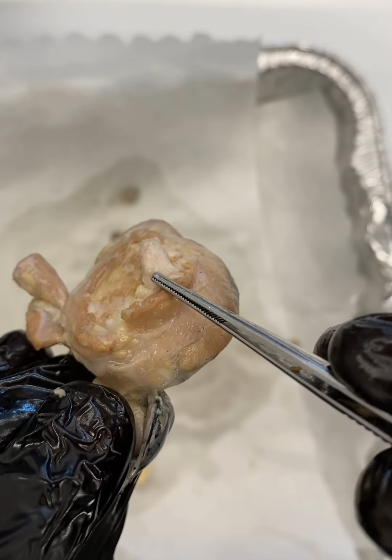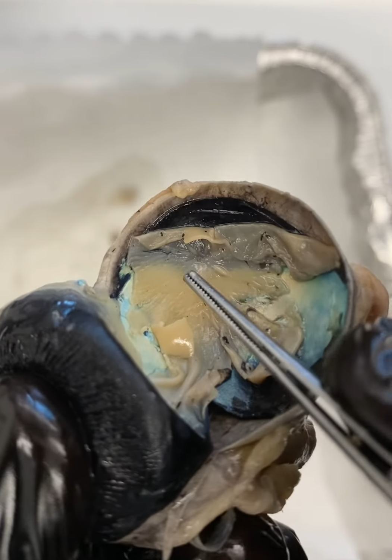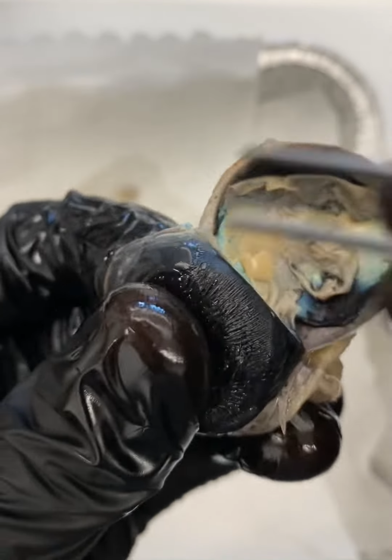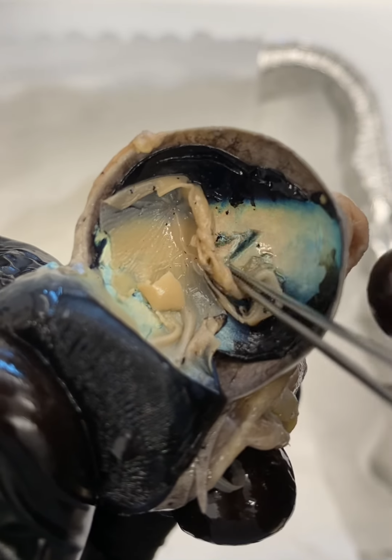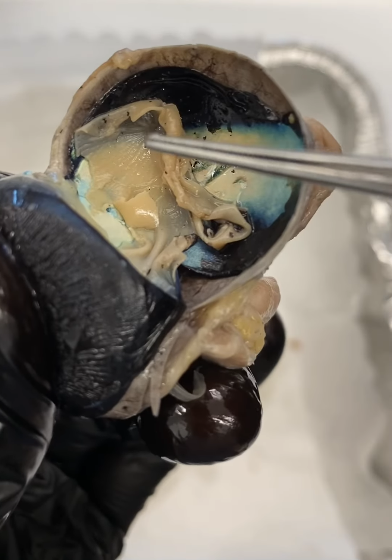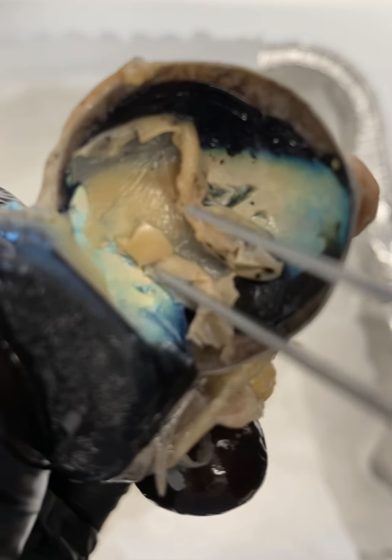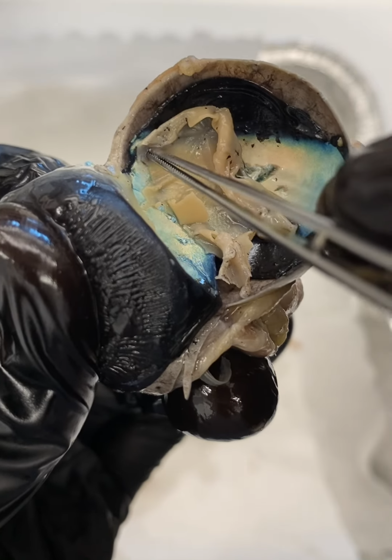Optic nerve on the outside of the eye, optic disc on the inside of the eye, right? So right here, right there. You can confirm this, and we're going to destroy the retina here. What you can do is take the retina and peel it from all sides, and you'll notice that it stays attached in one area. All this here, we can move, we can just peel it nicely, no big deal. But you'll notice it stays attached in that one area.